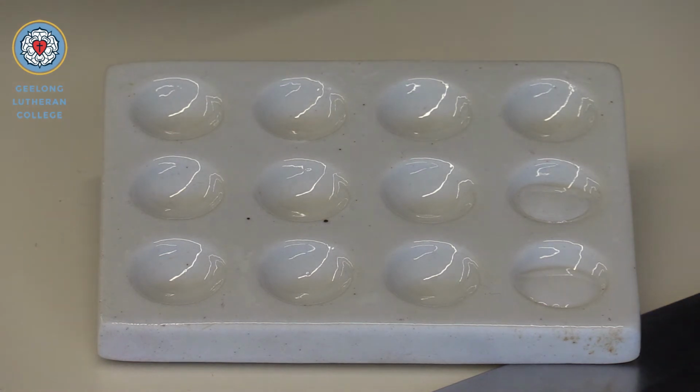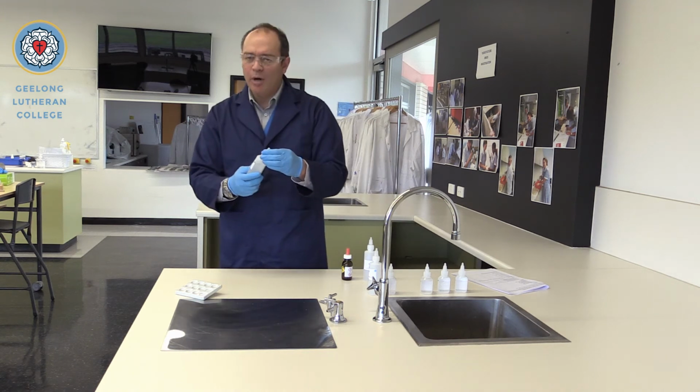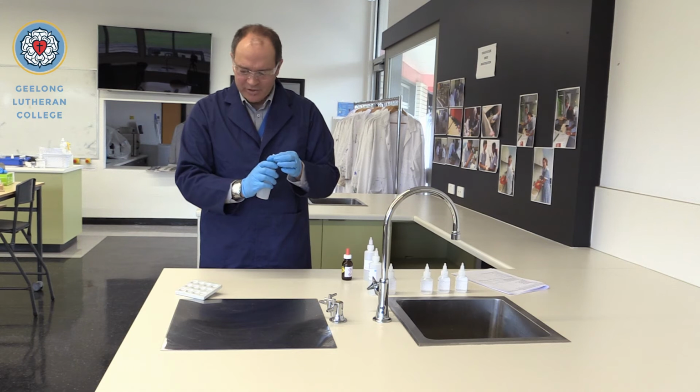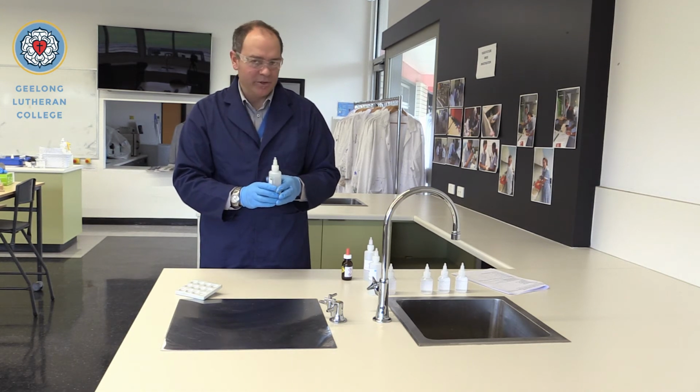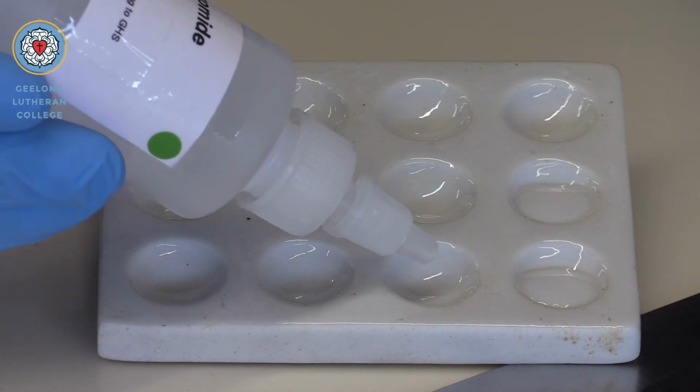Okay, so another precipitate formed, and fair to say that they are the same colour, same texture as the first one we just tested there. Okay, so we're moving on now to looking at sodium bromide. So bromide is the halide in this compound that we're looking at, and we're expecting the silver to bond with the bromide. Let's check it out.